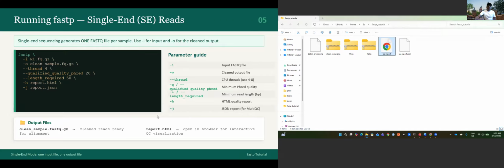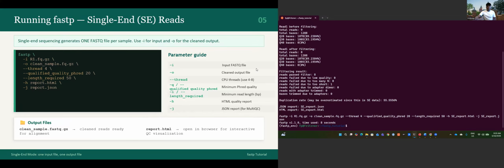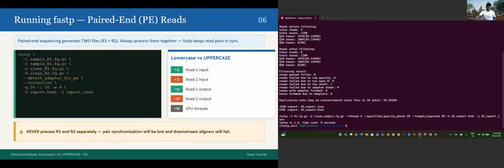Okay, let me go back to my terminal. This is pretty easy for the single end. That's pretty much it. Let's do the paired end sequencing. For the paired end, what do we need? Let me clear my terminal.